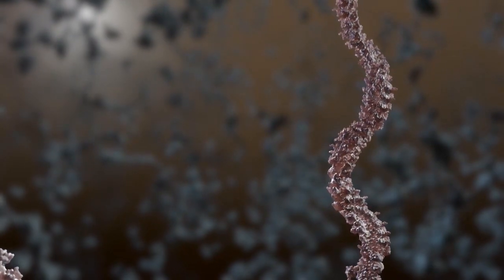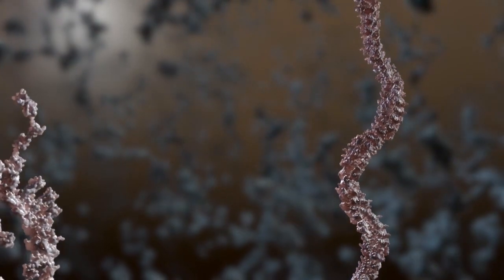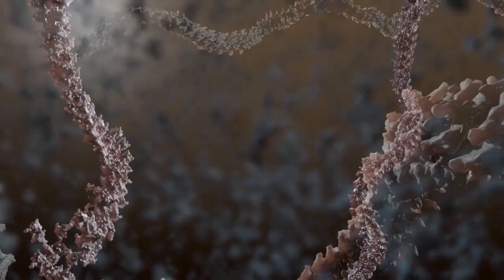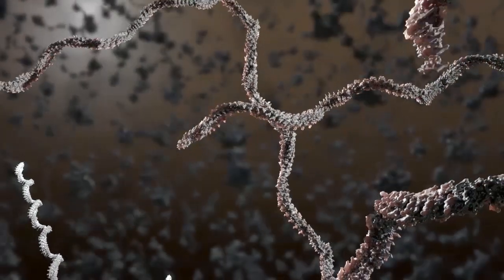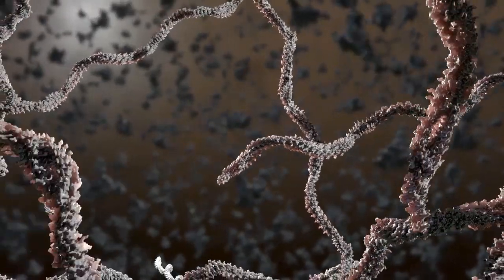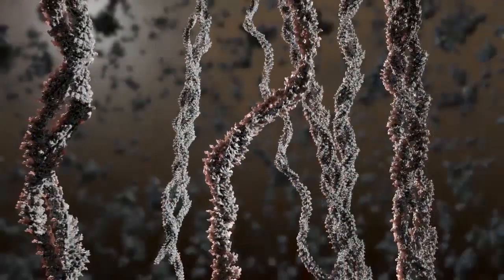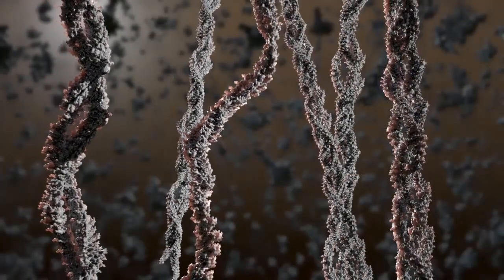Including amyloidosis and various neurodegenerative disorders. To understand these diseases, we need to know the structures and behavior of the molecules that are involved, so we can apply this knowledge in the development of therapies for patients. SAXS gives us the possibility to get this knowledge, as we can investigate in real-time the details of molecular processes like fibril formation.